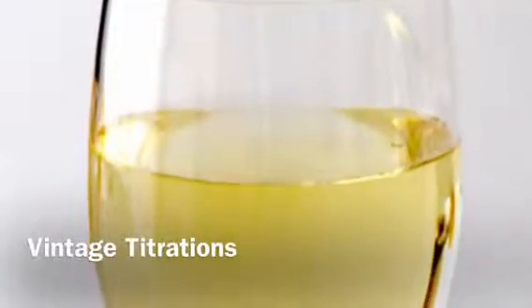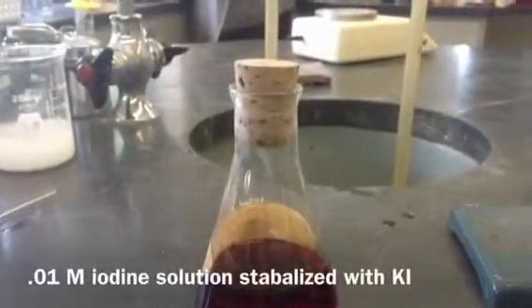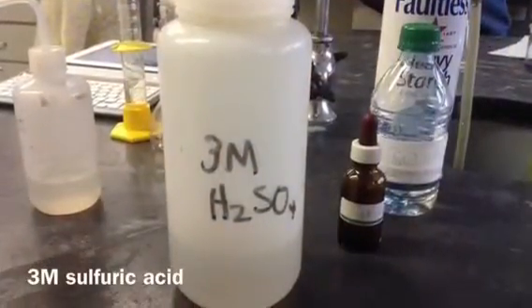For my experiment, I set out to find the amount of sulfur dioxide in white wine. To do this, I would be using redox titration with iodine as my titrant, the sulfur dioxide in the wine as my analyte, and starch as an indicator.